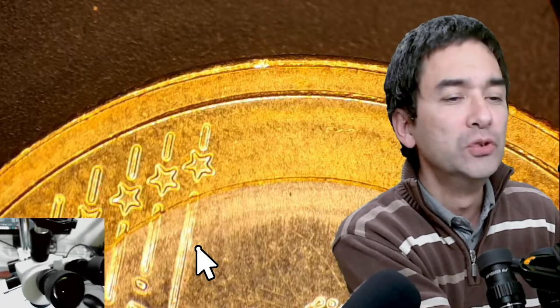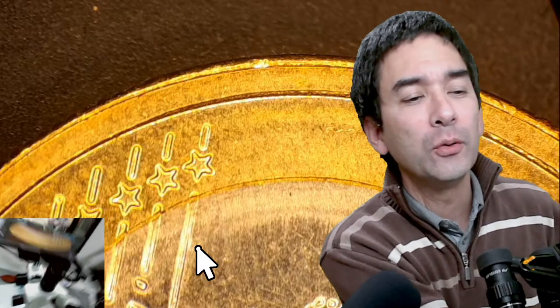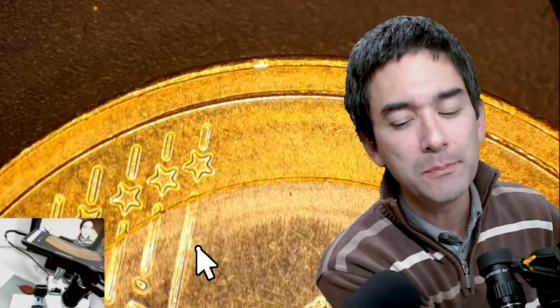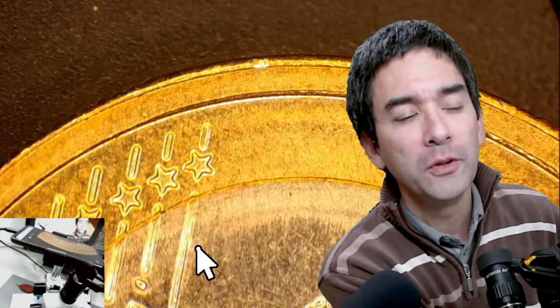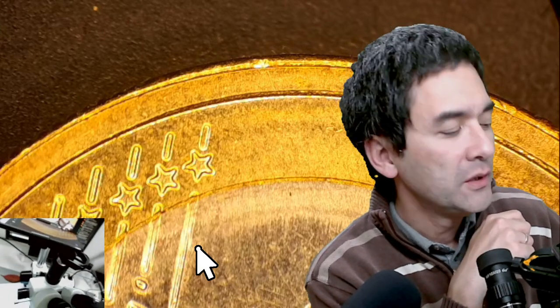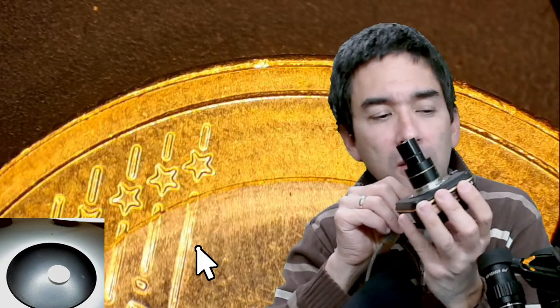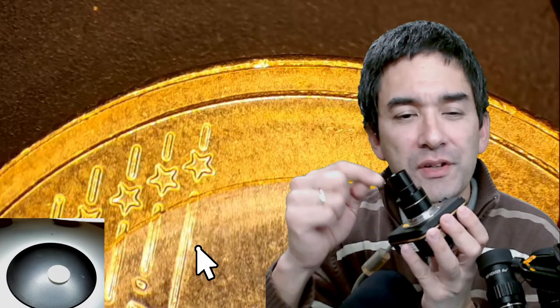The big surprise: instead of an advanced camera, I've connected my mobile phone! The mobile phone is connected over USB to my computer, and I'm using it as a webcam using a specific app. You might wonder why — the reason is simple: the image quality is better than my dedicated microscope cameras. Those typical microscope cameras are good for compound microscopes, but the image is a little bit blurry on the stereo microscope.